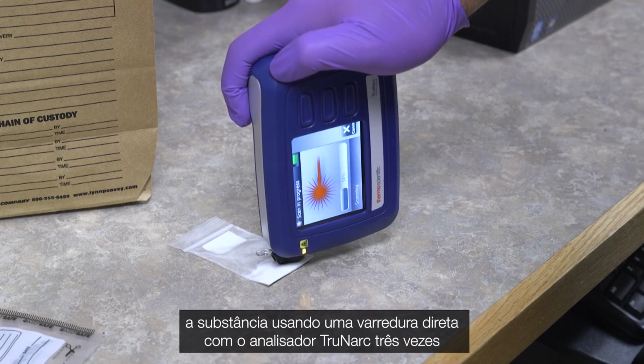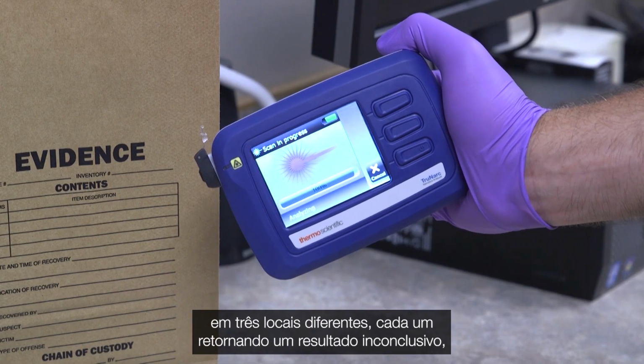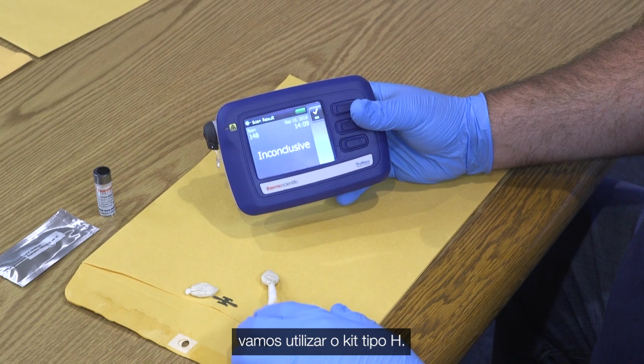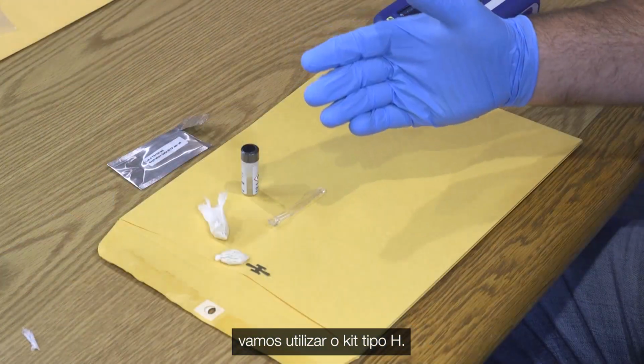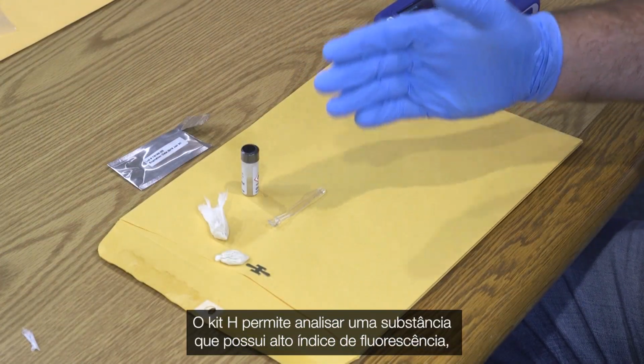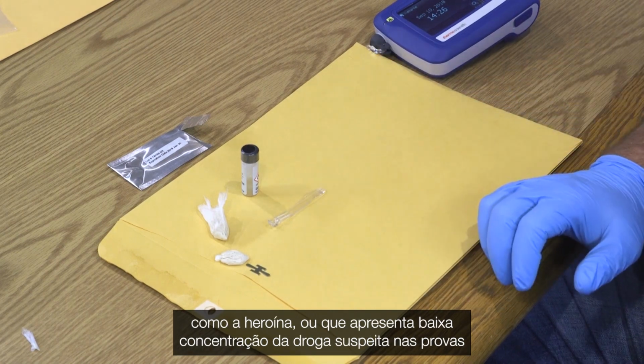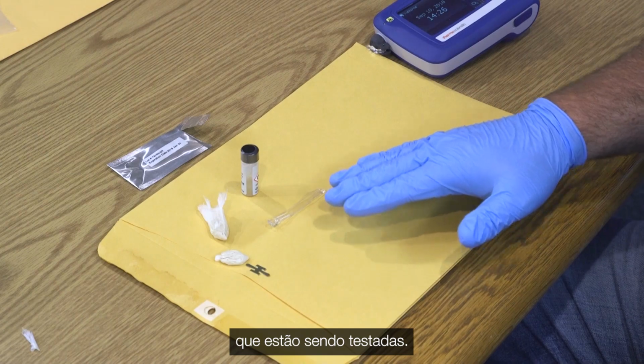After having tested the substance using a direct scan with the Trunarc analyzer 3 times in 3 different locations, each returning an inconclusive result, we are going to utilize the Type H kit. The H kit allows you to analyze a substance that has a high rate of fluorescence, such as heroin, or has a low concentration of the suspect drug in the evidence being tested.